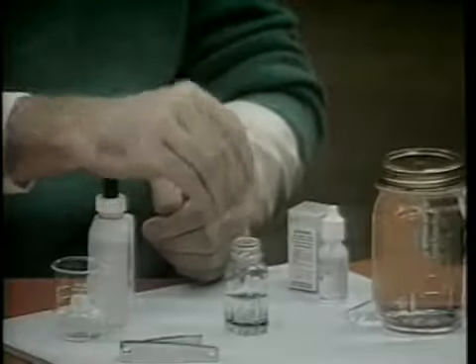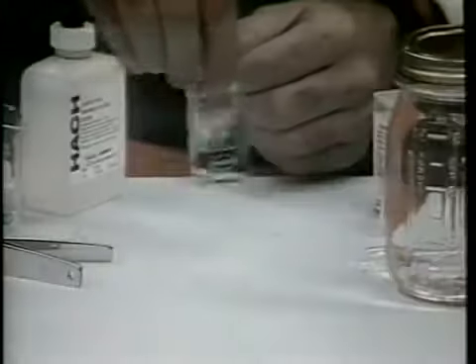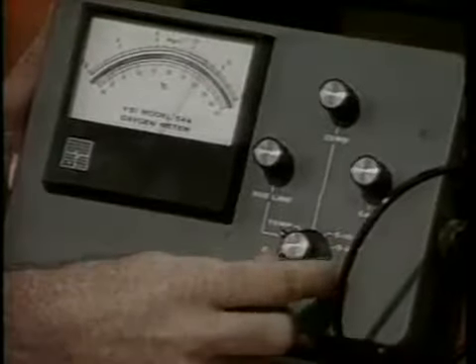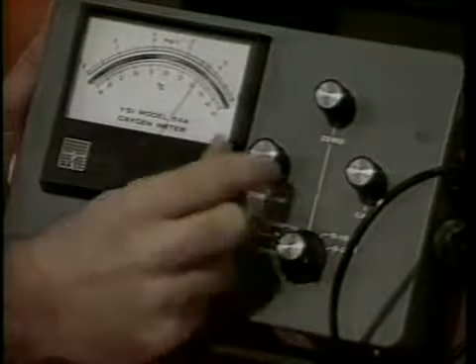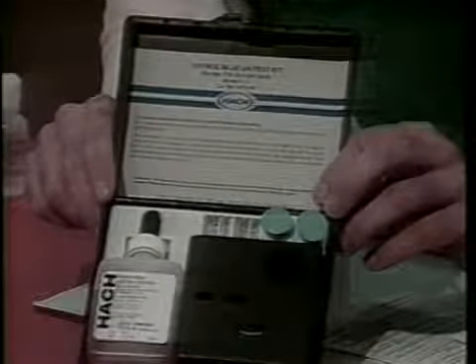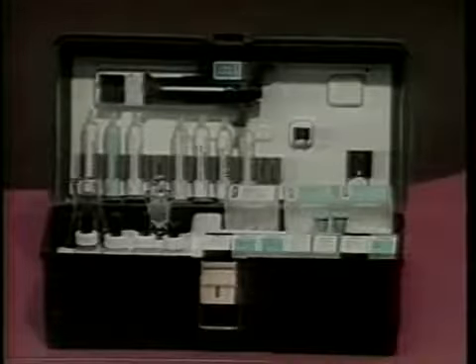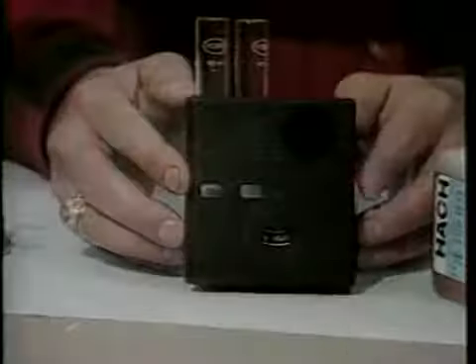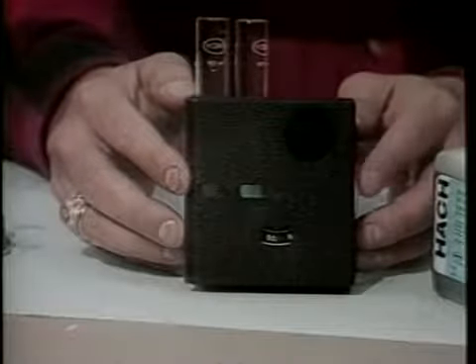Testing procedures and corrective measures concerning total alkalinity and hardness were presented in tape 1 of this series. Throughout this video, water testing equipment such as kits and meters will be shown. Testing examples will employ a specific kit or meter simply for convenience. The producer of this video series did not endorse any of the particular kits or meters. Keep in mind that other kits and meters are available and procedures may differ slightly from the examples shown in this video.